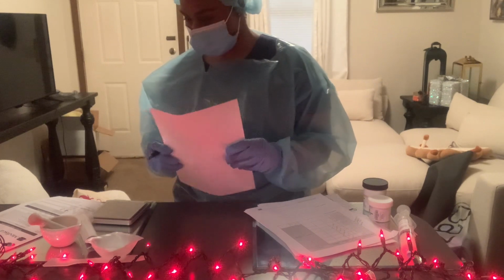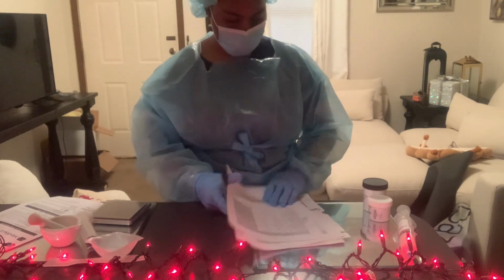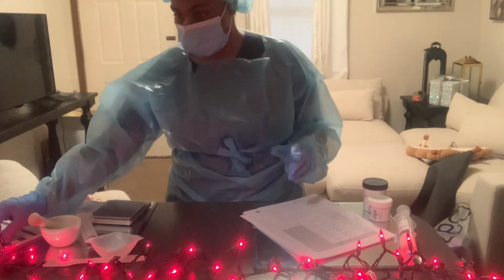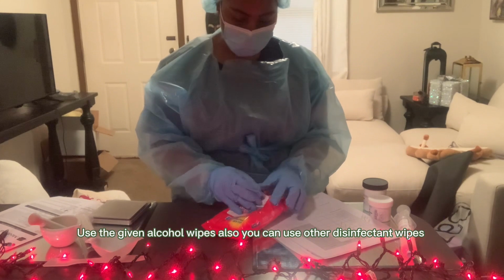Okay, so now that we've completed our compounding record, I'm gonna put this to the side. And then we're going to clean our materials. So, got some disinfectant wipes.